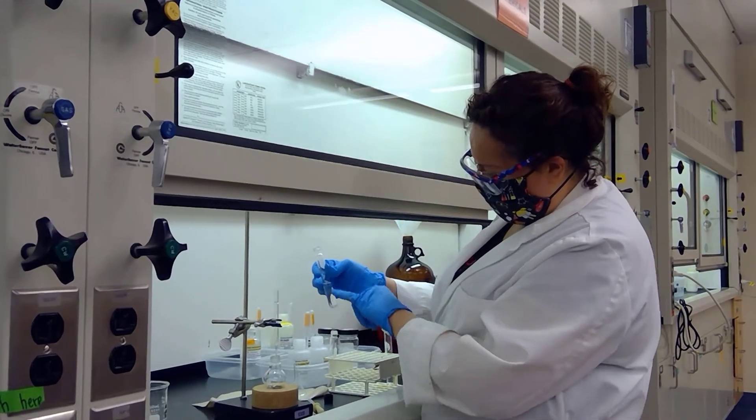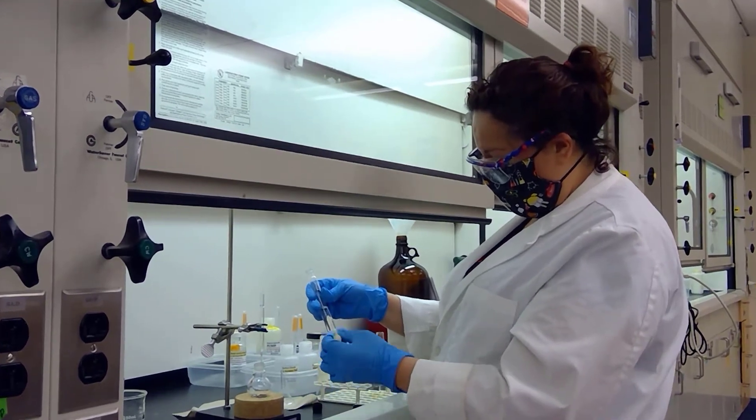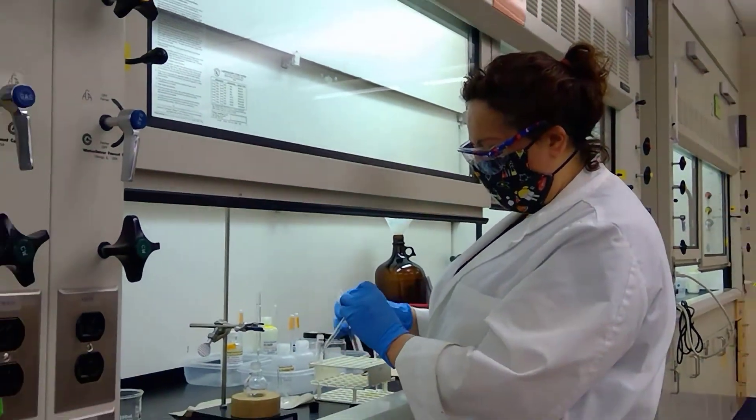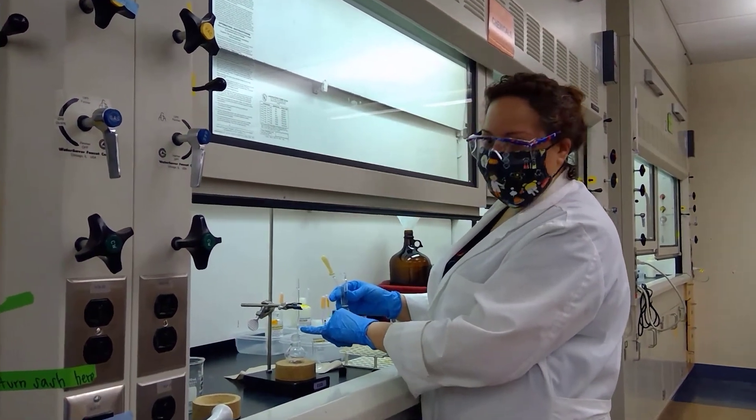Okay, our salt, solvent, and mixture has been sitting with magnesium sulfate for about five minutes. I'm going to go ahead and pour our sample through. I have a pipette here with a small piece of cotton at the end to act as our filter.